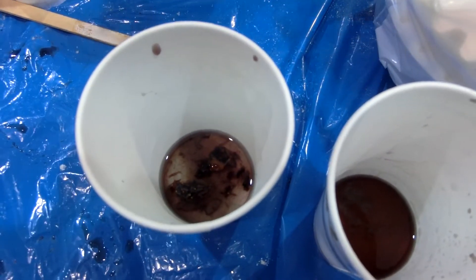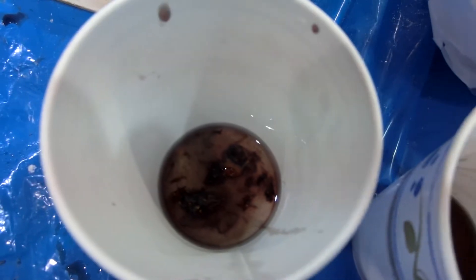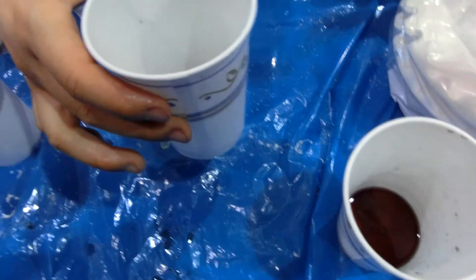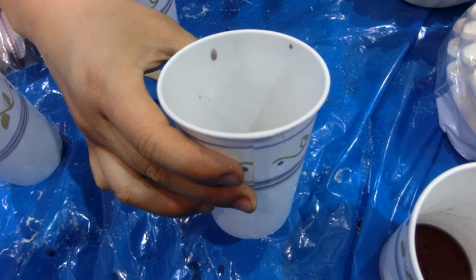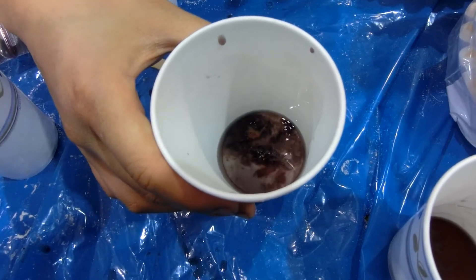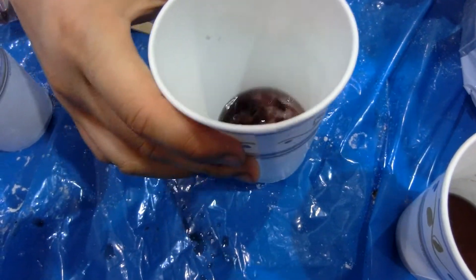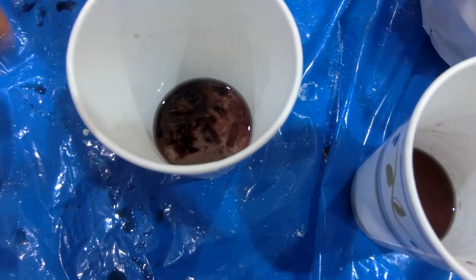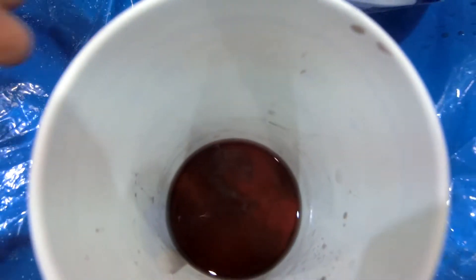And let's see. So if this were another organism, or if we wanted to grow a strawberry, we would take this DNA and express it in a bacteria, which would hopefully make DNA for us. So this one does not look like it's coming out, which is kind of a bummer. But if you were to look at this one, for example, that white stuff up top is the strawberry DNA — this one's been sitting longer.